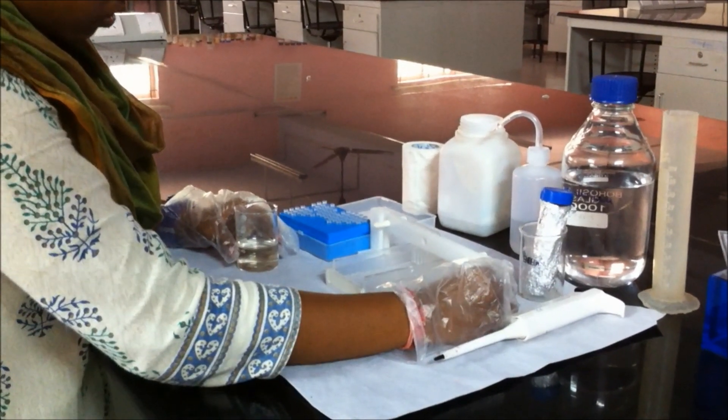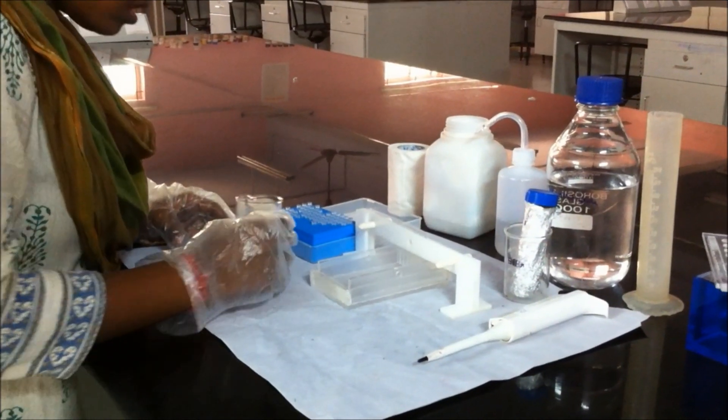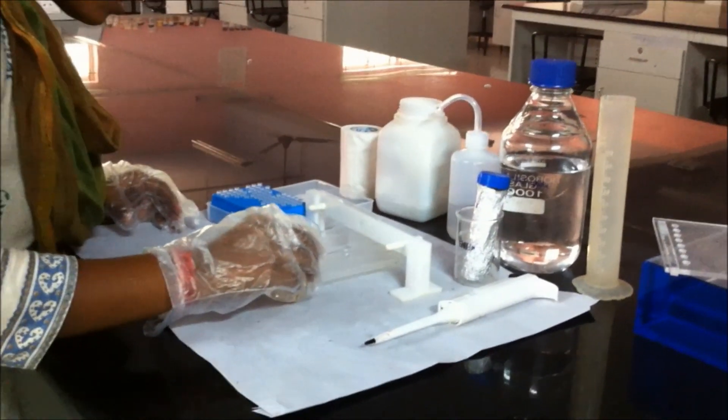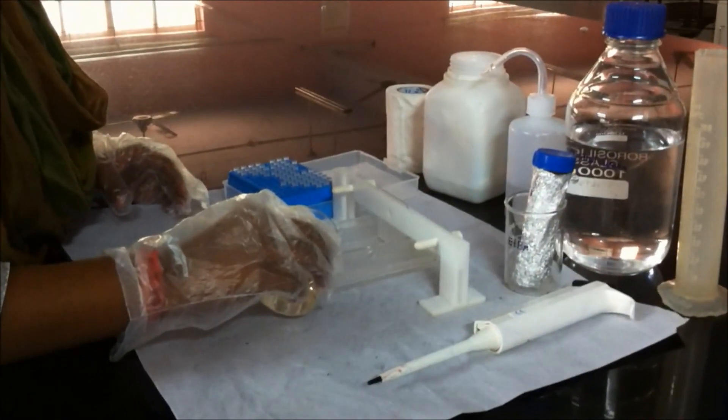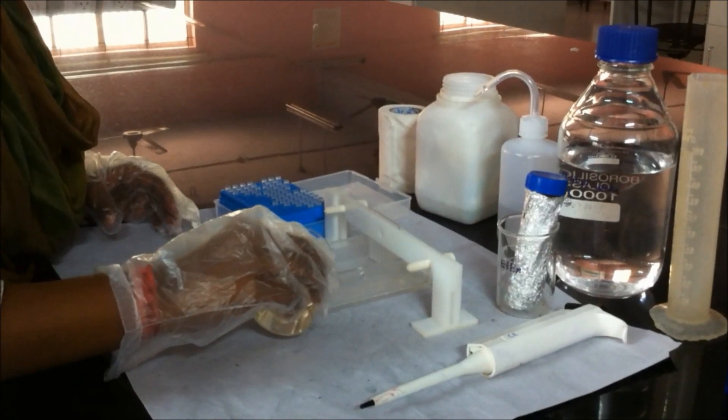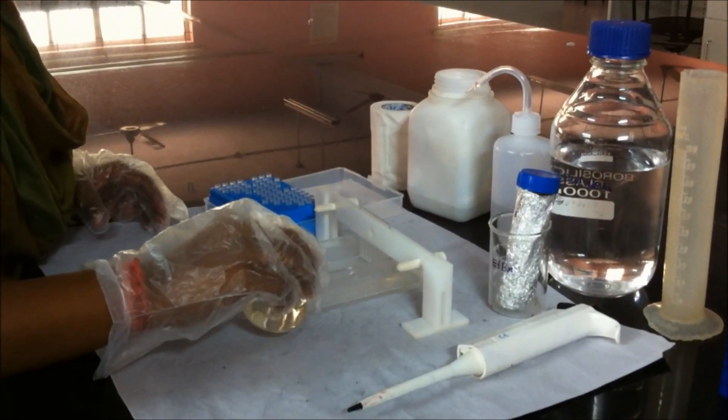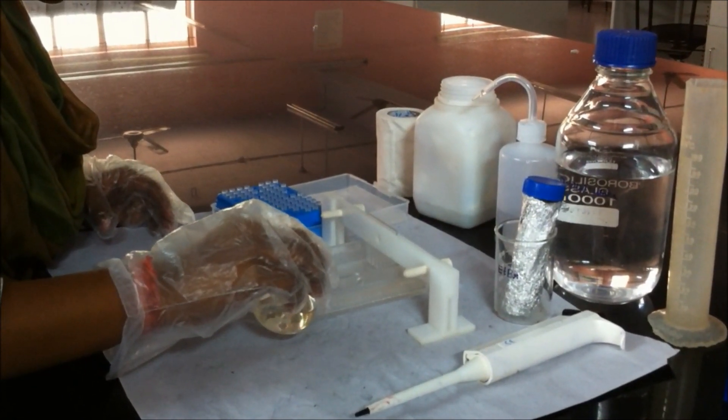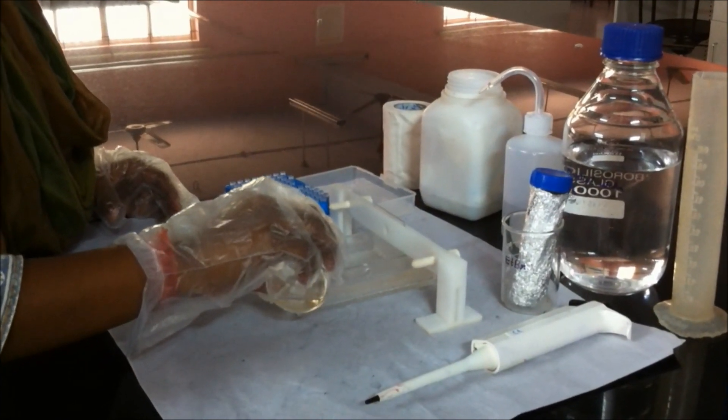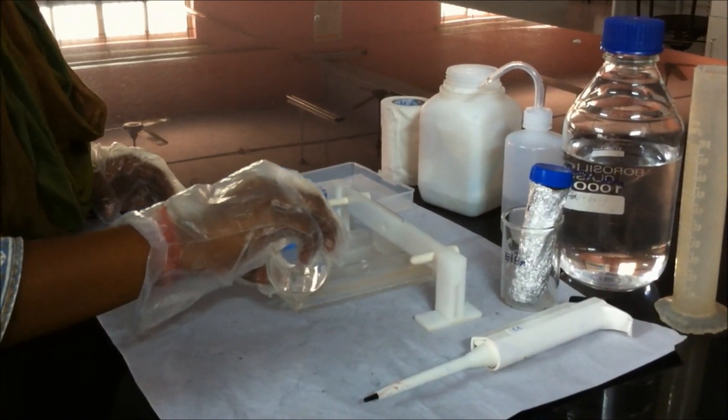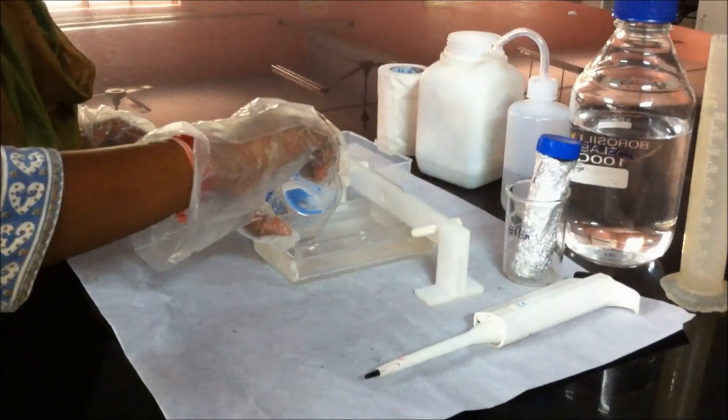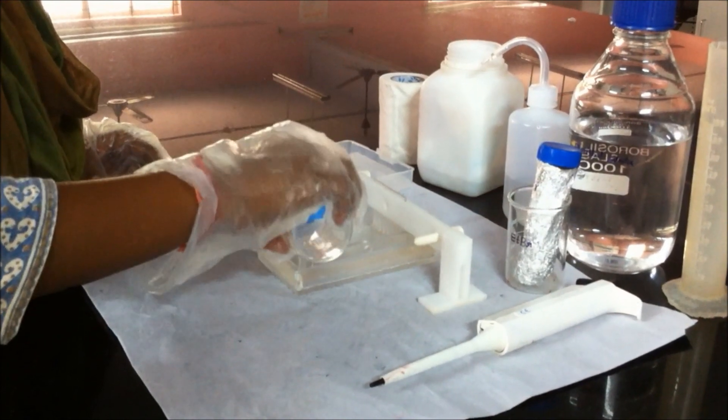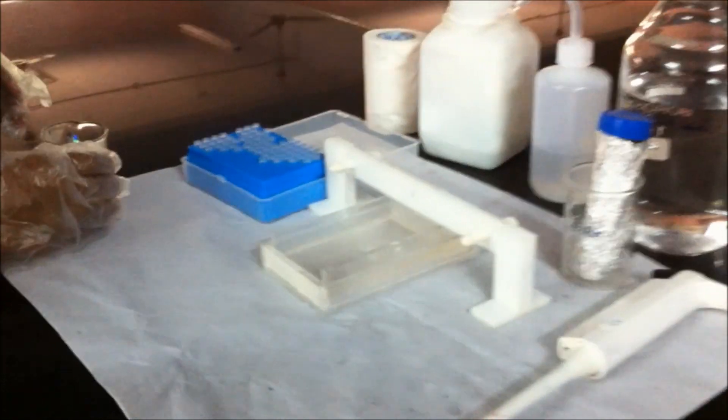Pour it carefully into the plate. Allow it to solidify.